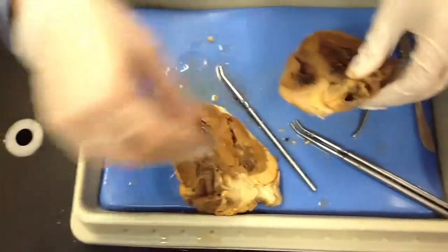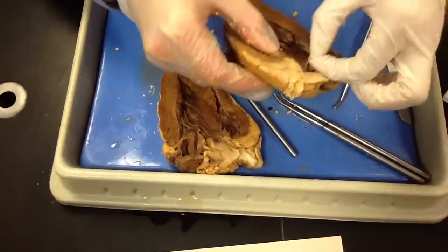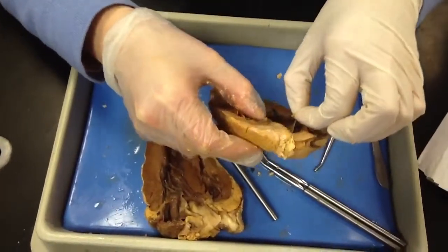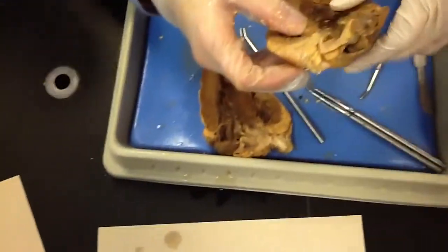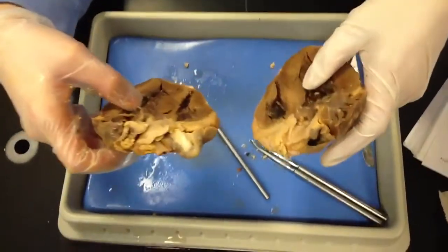It's just how you cut it that messes me up, because this is where it was. I was just looking to see where the valve was. We're going to have this phenomenal heart to be able to find all these locations on this practical. I'm going to cut them for you guys. I'm going to have probes sticking in through the blood vessels.